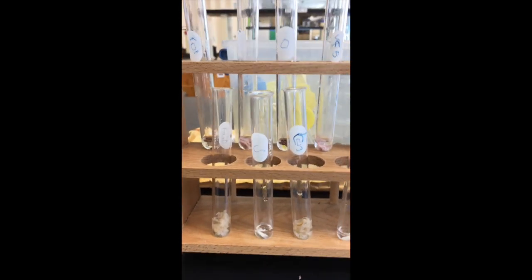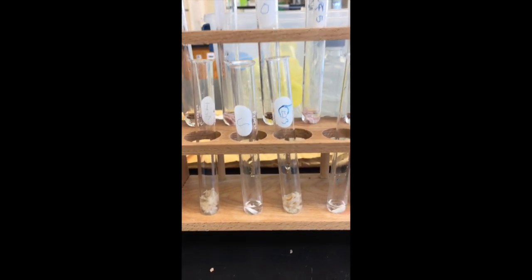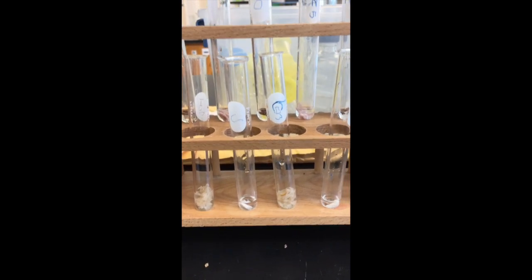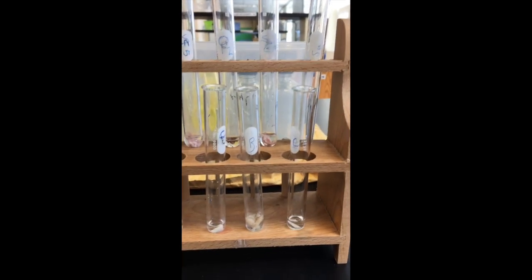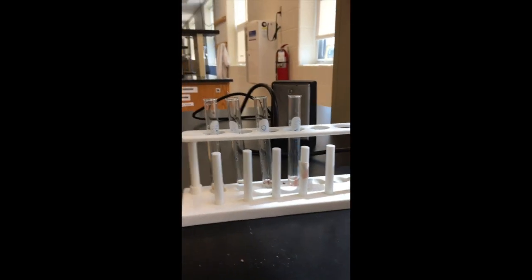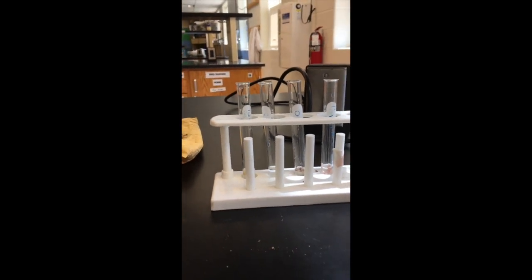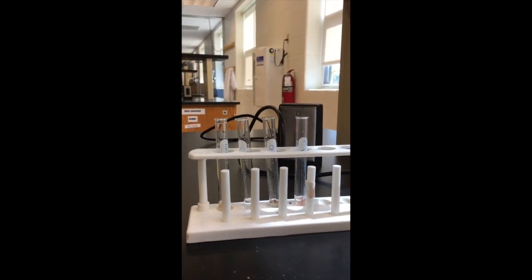Now the idea is that in the presence of the indicator chemical, if there are simple sugars, simple carbohydrates, monosaccharides in that particular sample, it will change the color of the indicator chemical. You do it with one of the different indicators, and it does that in the presence of complex carbohydrates or polysaccharides. If you do it with a different chemical, it changes color in the presence of protein. And the idea is that we're going to be testing each of the 4 types of food for the different sorts of macromolecules.